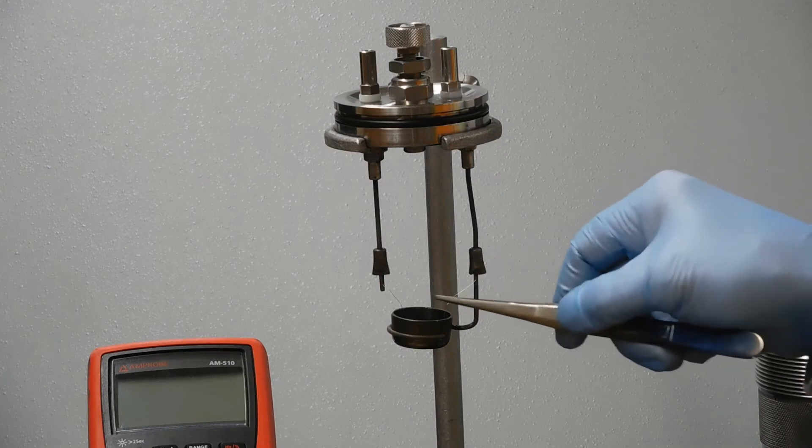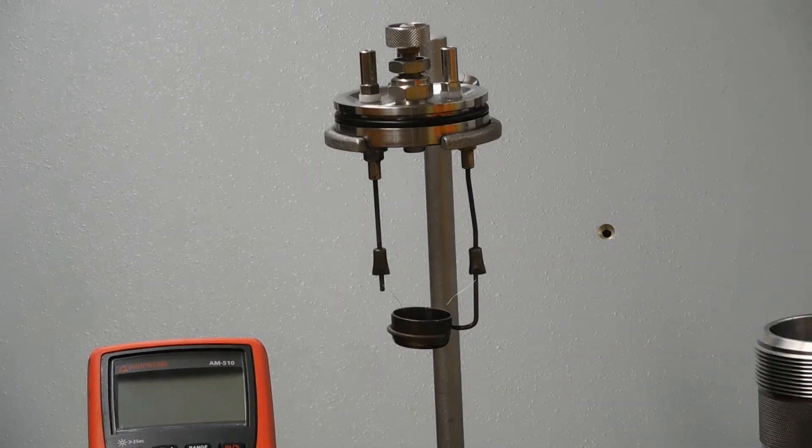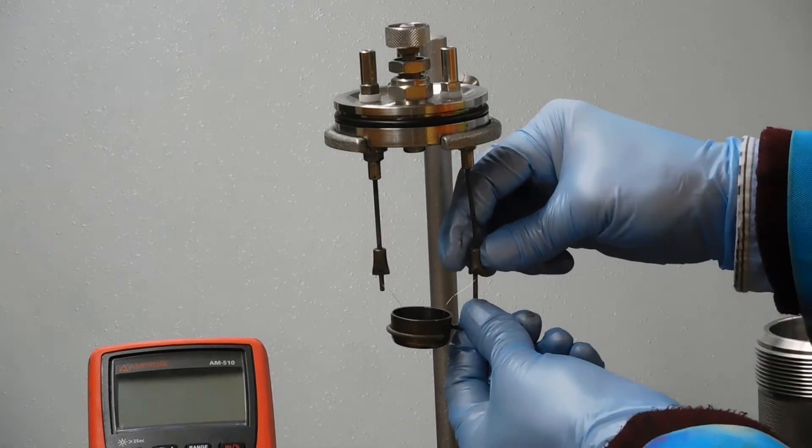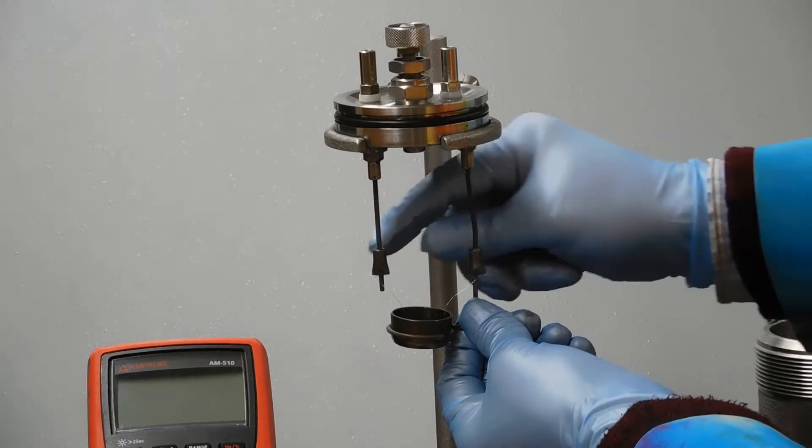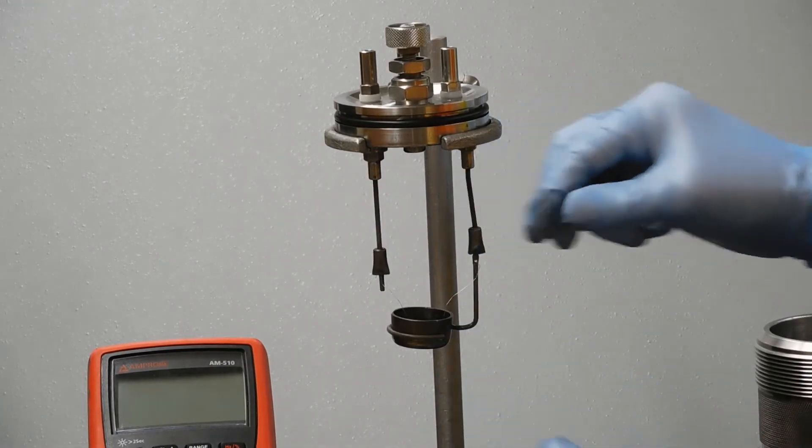What I've got is a loop of the wire touching the pellet. I'm going to zoom in so you can see that. I'm also going to raise one of the holders before I zoom in so you can see the way the wire goes underneath.